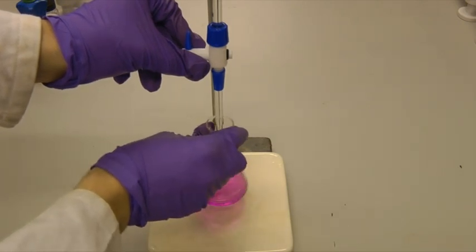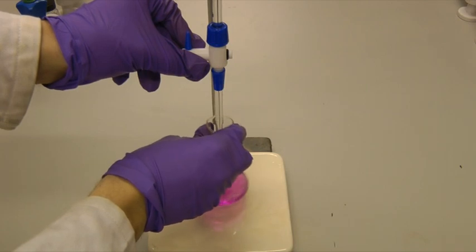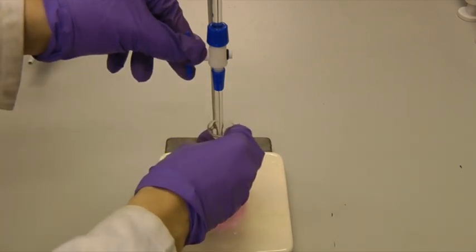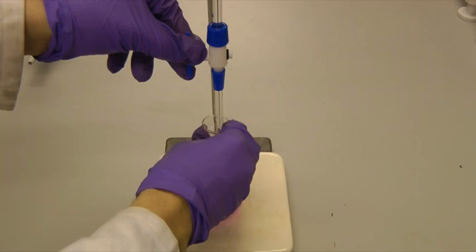If you're left-handed, then you should use the opposite hands for these processes. Some teachers may prefer for you to hold the flask or the tap in a slightly different way, so please make sure you follow their instructions carefully.